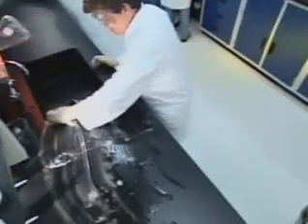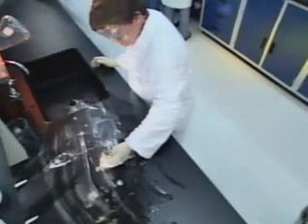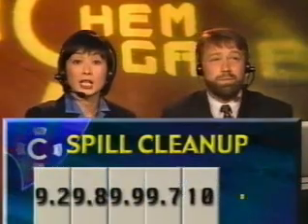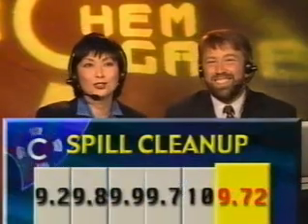Well, it looks like they've got their acids and bases covered over there. But what do the judges think? Should be another good one, Mia. That was a beautifully executed cleanup. The judges agree and give a 9.72.